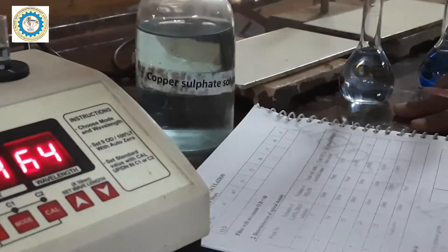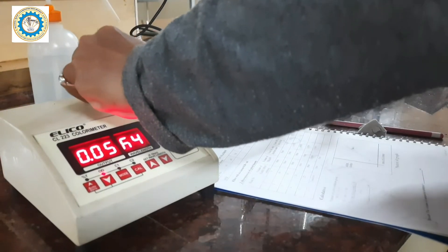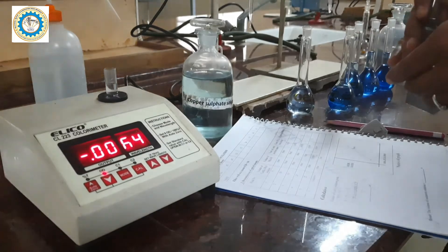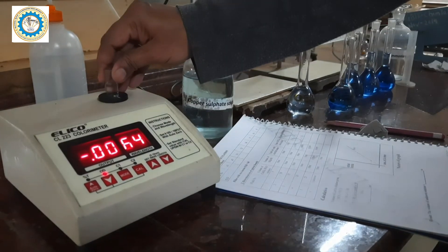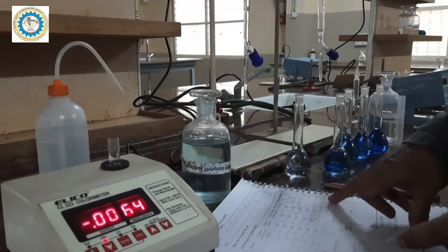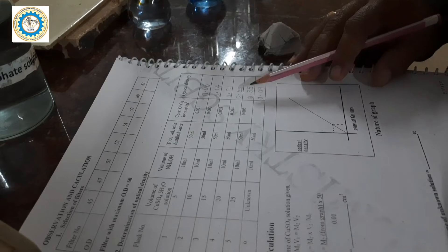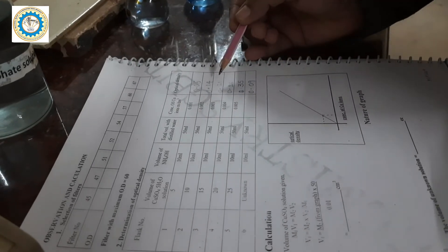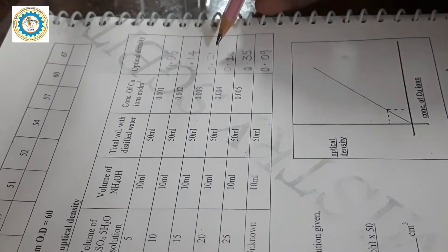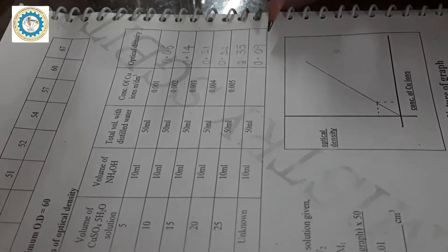Similarly, again I am going to insert the blank and find the OD for all the solutions. Along with that, I am going to find out the optical density of the unknown solution. In this same way, we have determined the optical density of the second, third, fourth, fifth, and unknown solutions. We have got very good readings.